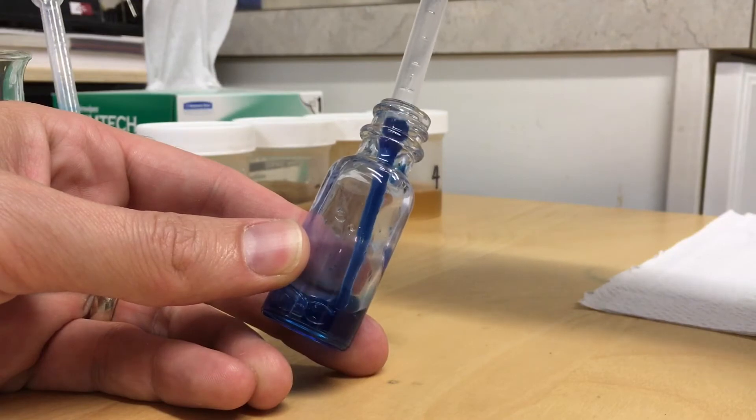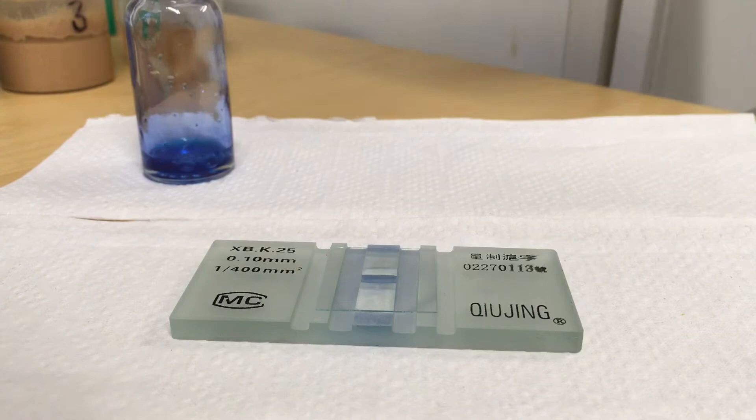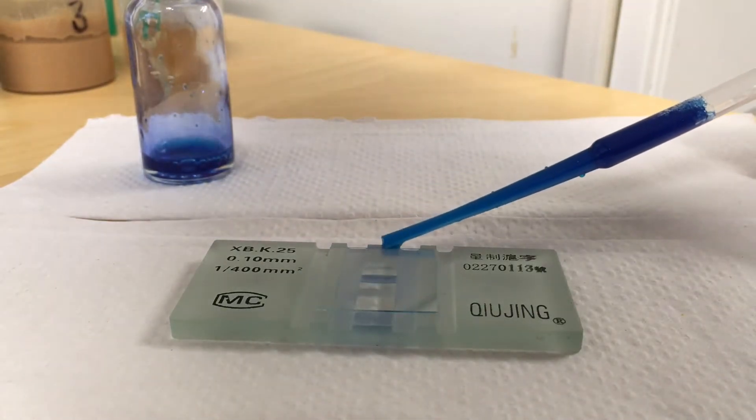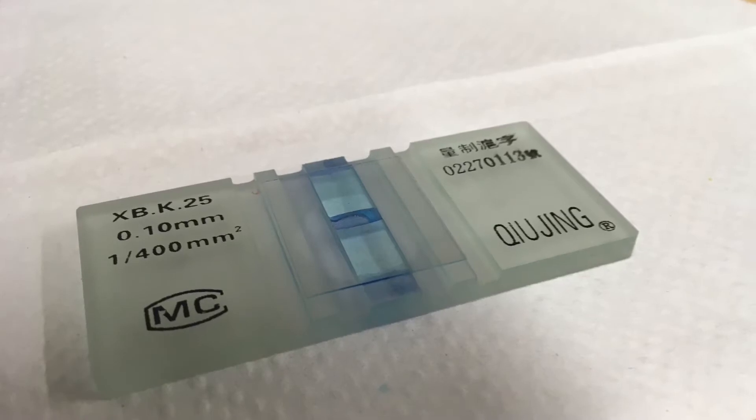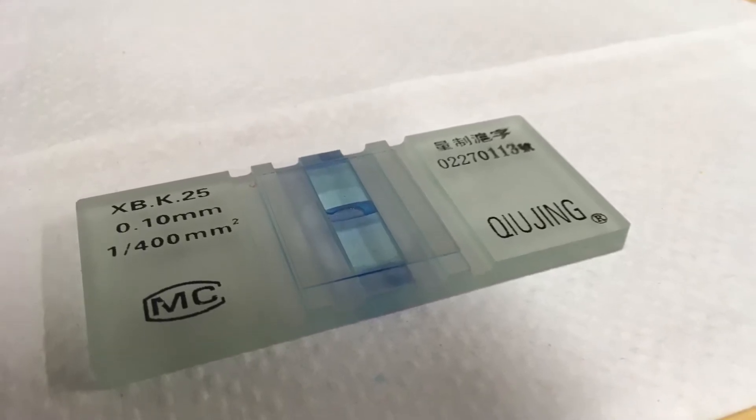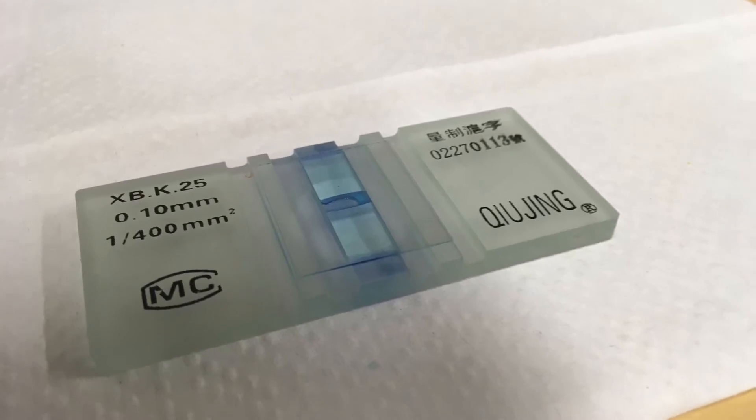Give your final sample a little swirl, and then take some up in your pipette for the hemocytometer. I fill both chambers of the hemocytometer, and then do an average to ensure accuracy. If a small amount of liquid makes its way into the reservoir in between the two chambers, that's okay. If it fills the whole thing, you'll want to try again.